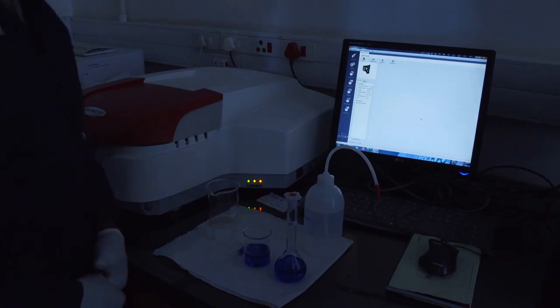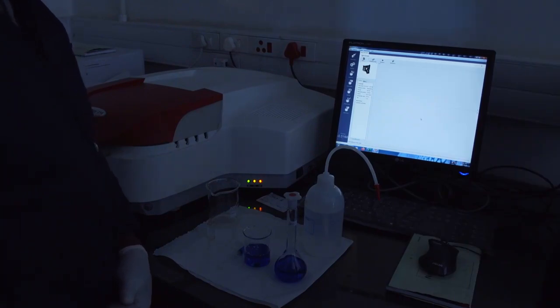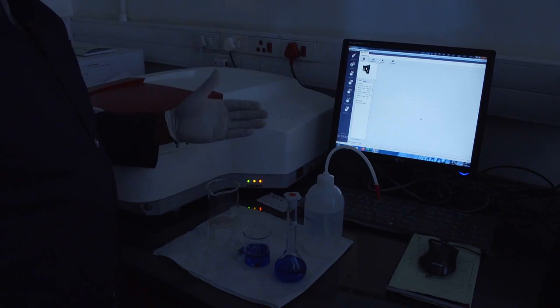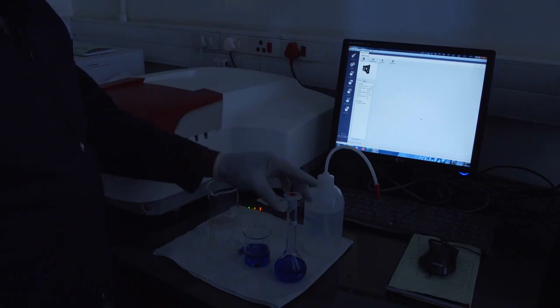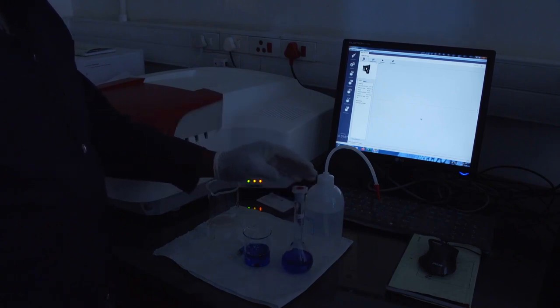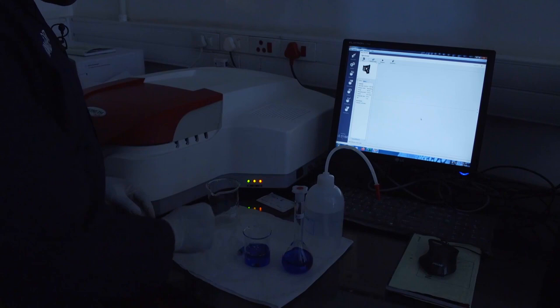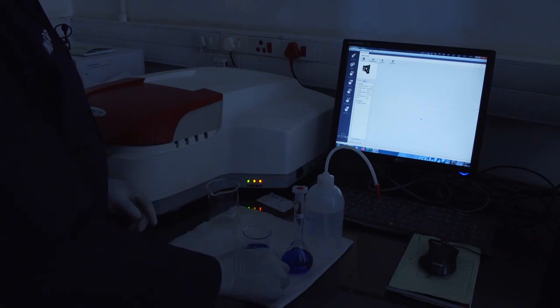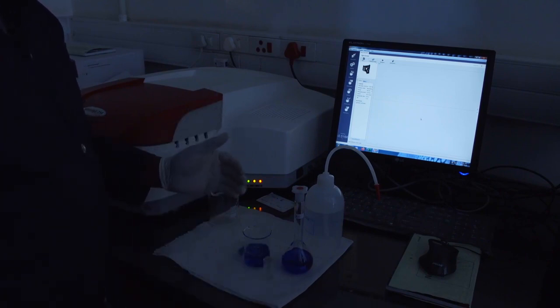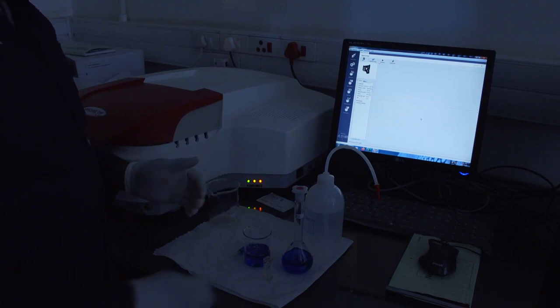For the photocatalytic degradation of methylene blue, we start by determining the initial concentration of our stock methylene blue solution. The first thing we do is run a reference — in this case, our reference is the distilled water used to prepare the methylene blue.